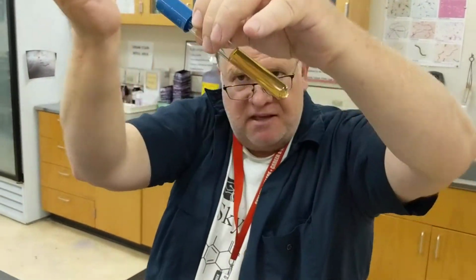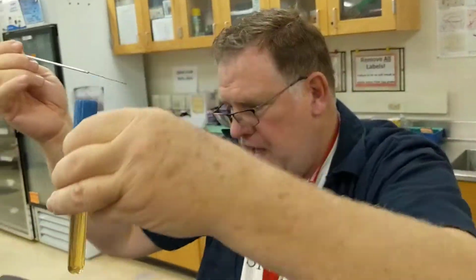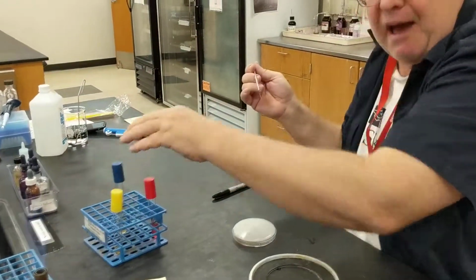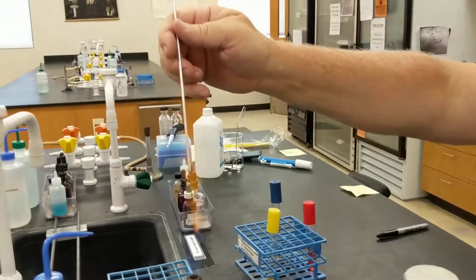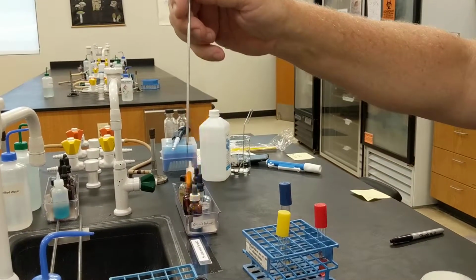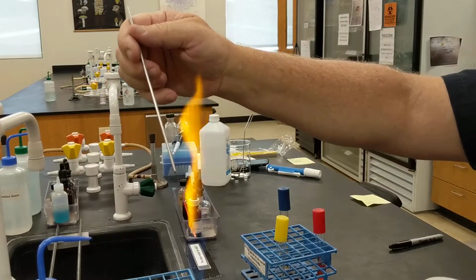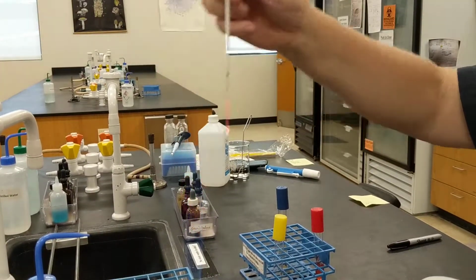If you look at it, you may take a picture, just hold it like this, and you see that it is solid. We're going to come back and see what happens. If the microorganisms grow and produce some proteases that will break down the protein, we should be able to see that result. I'm going to sterilize my loop again. We sterilize it right after we do any of our activities, and I get it all red hot.